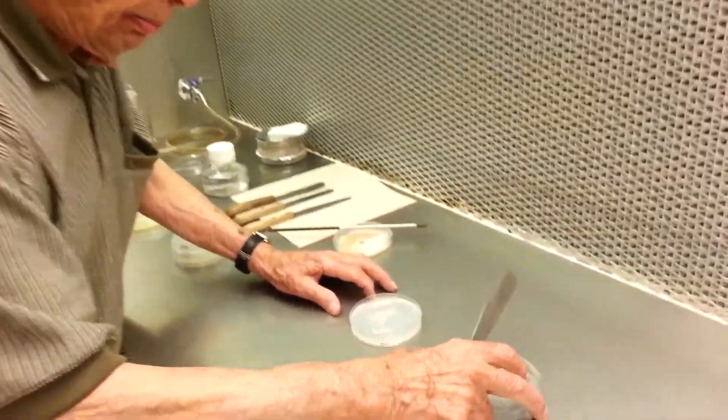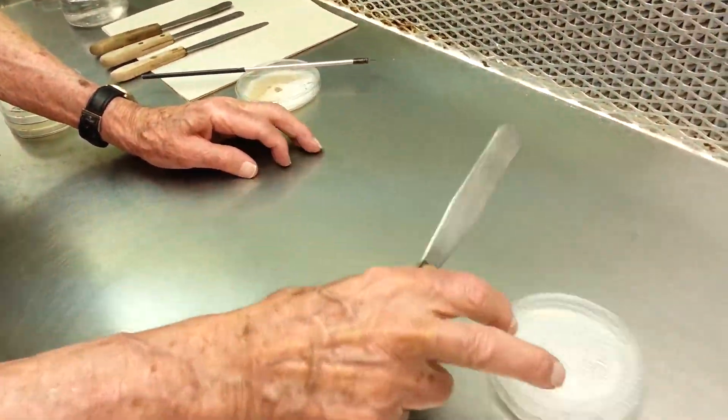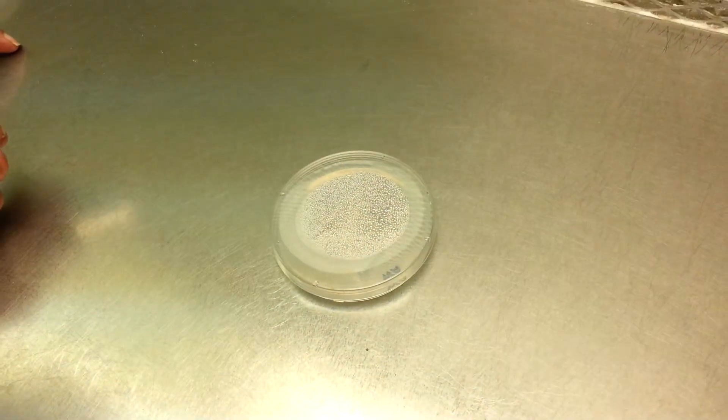Okay. That'll take about a week for it to grow through. That's the water agar method.